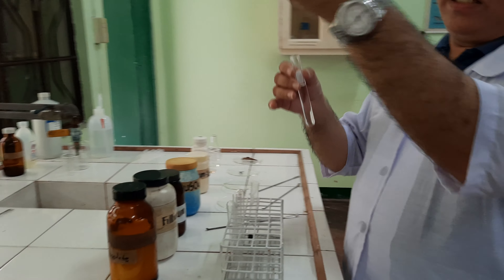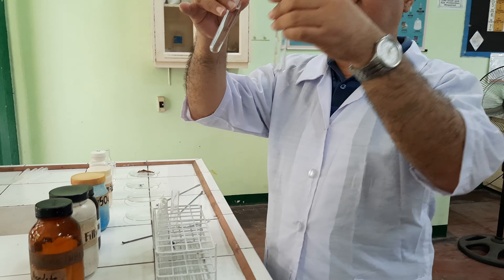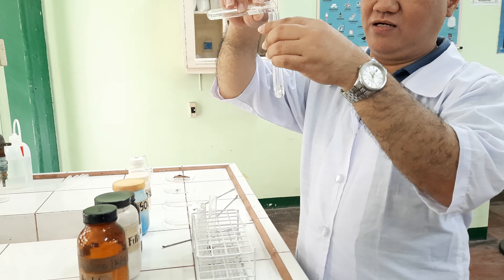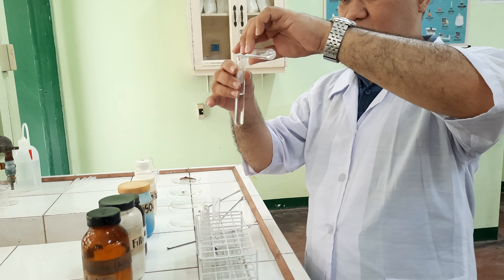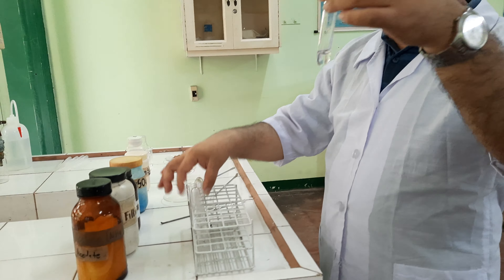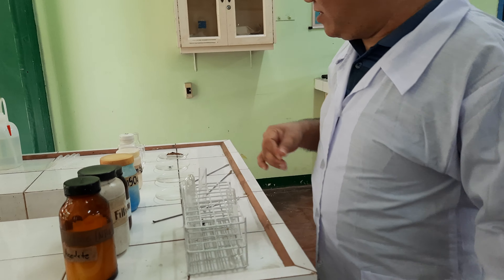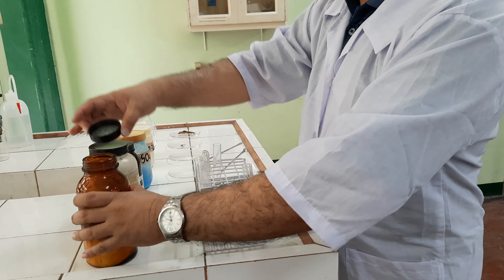In a small amount of water — since this is 20 ml, we need only 2 ml — so let's just estimate one tenth of this. More or less, one tenth or 2 ml.